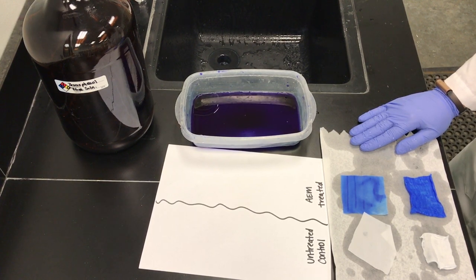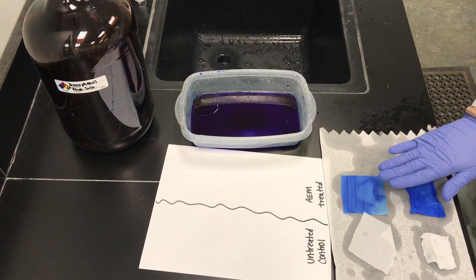It is always best to compare the staining of the treated sample to an untreated control.